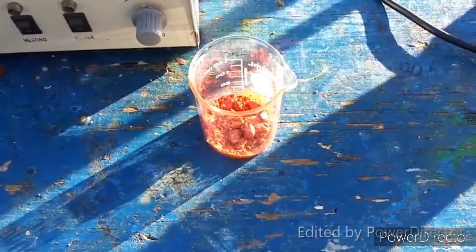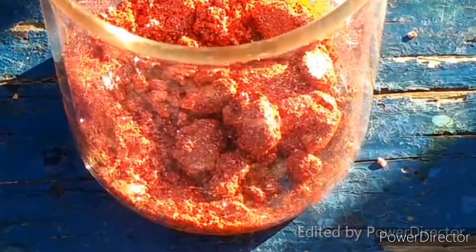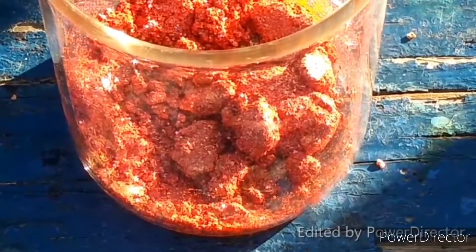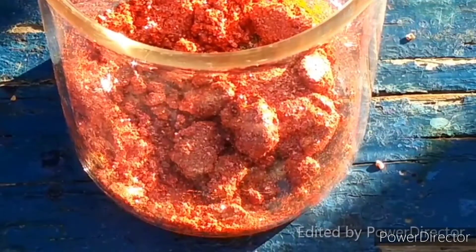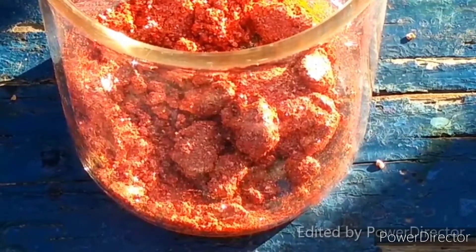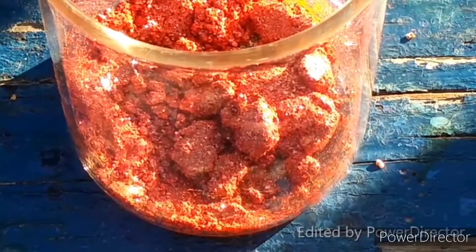I have tried this on a small scale and after a couple of days of actually playing around with this — see, it's very pretty — I have figured out how to finally make it work. I'm not sure if my previous conclusions about dissolving arsenic in RFNA producing mostly arsenate are true or not. I think they are, just because of the precipitate that it gave me with copper acetate.